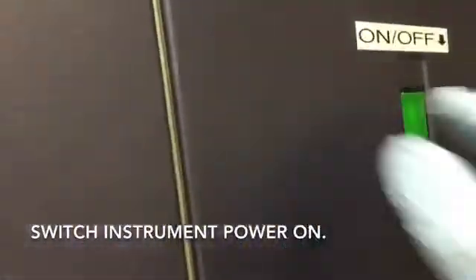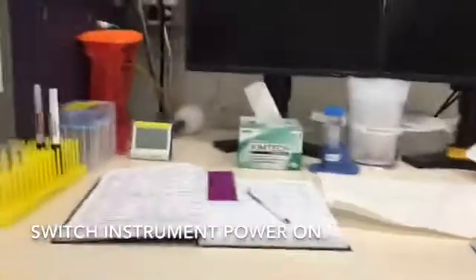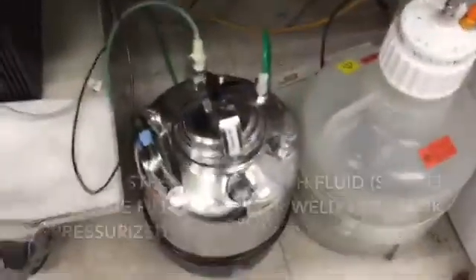First of all, you'll see that the instrument power is off. Let's turn the power on — push the big green button — and then we'll start the computer. While the computer is starting up, I'll show you the two tanks below.